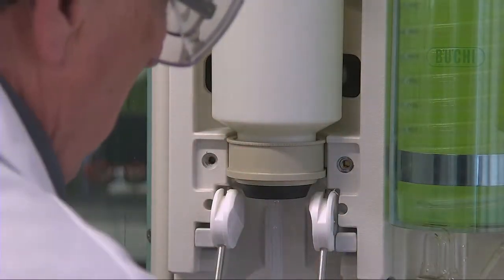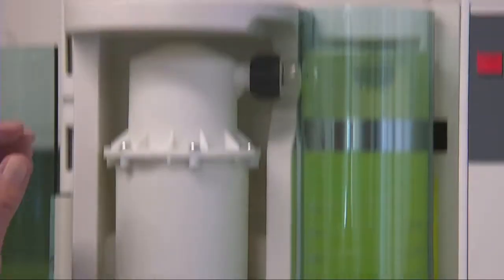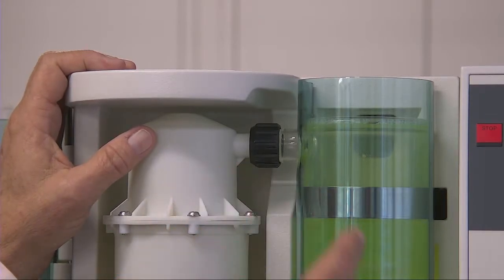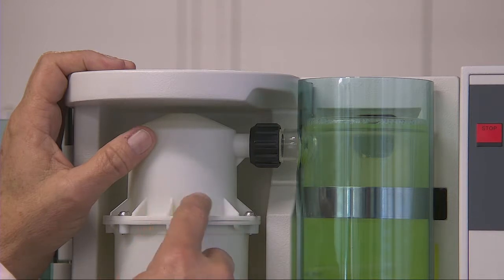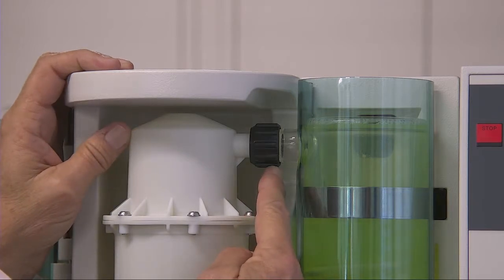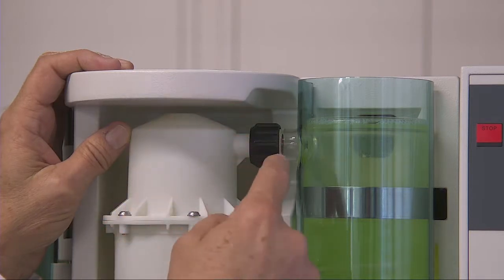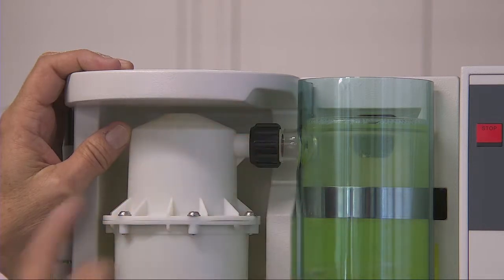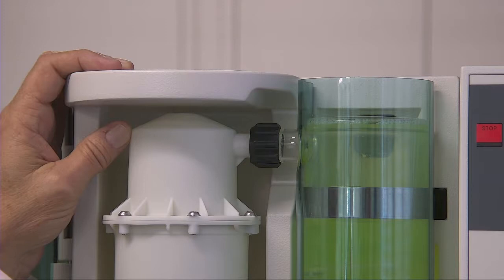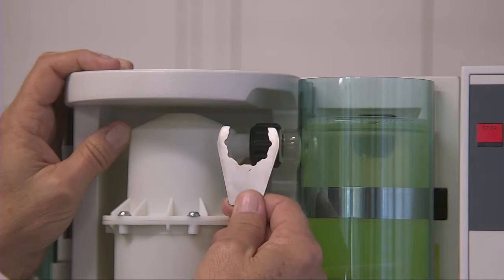Now, the next area that is typically leaking when you're losing nitrogen or if the aspiration isn't working is the nut or the seal between the splash protector and the condenser. This is the seal between the splash protector and the condenser. There is a white Teflon ring that makes that seal inside there. It's quite normal for that to get loose. So you should use this tool from BUCHI to tighten that condenser.